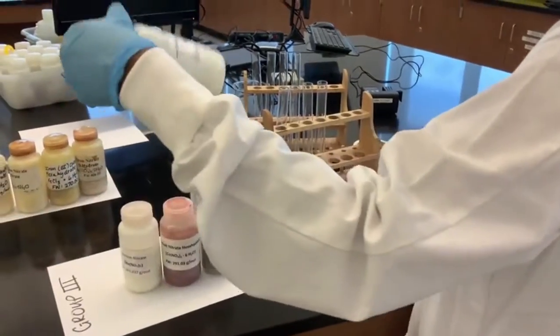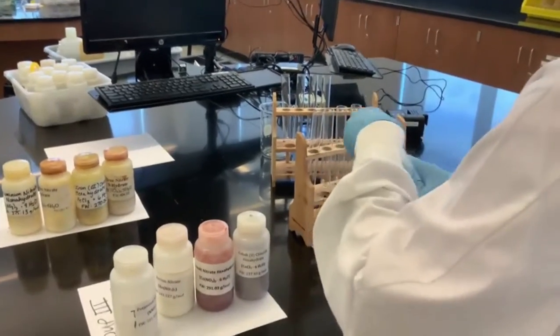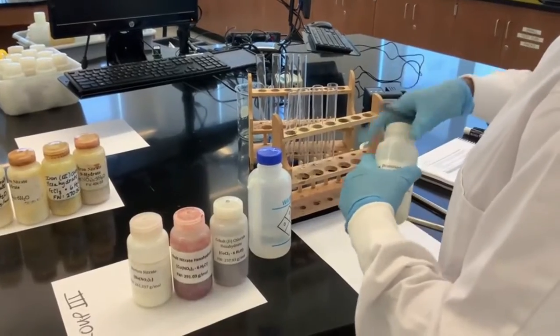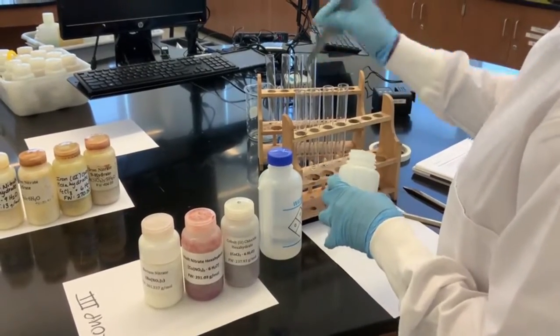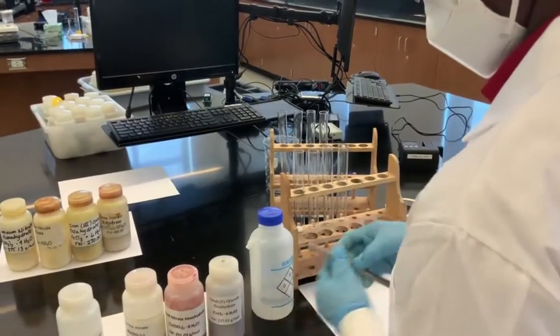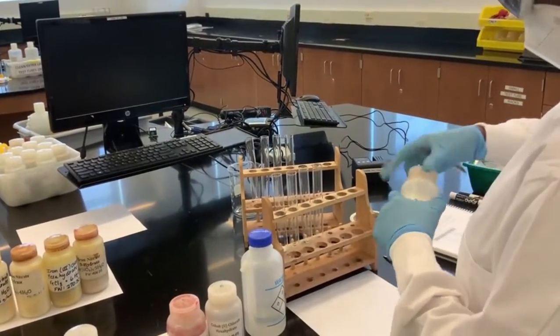Start with potassium nitrate from group 3. You're just gonna put some water here. You can either put the salt first. Let's do the salt first. Just a little bit, a pinch of it in the test tube. Potassium nitrate is the first one. The second one is barium nitrate.